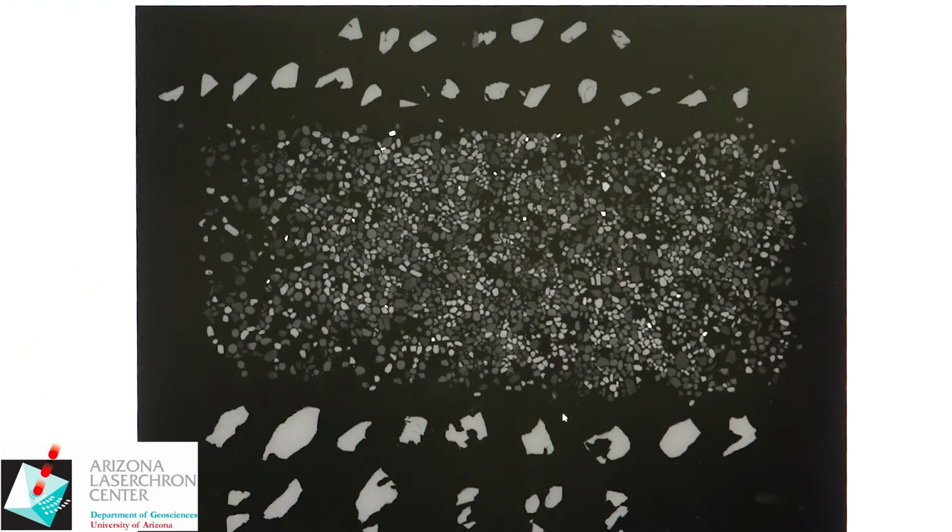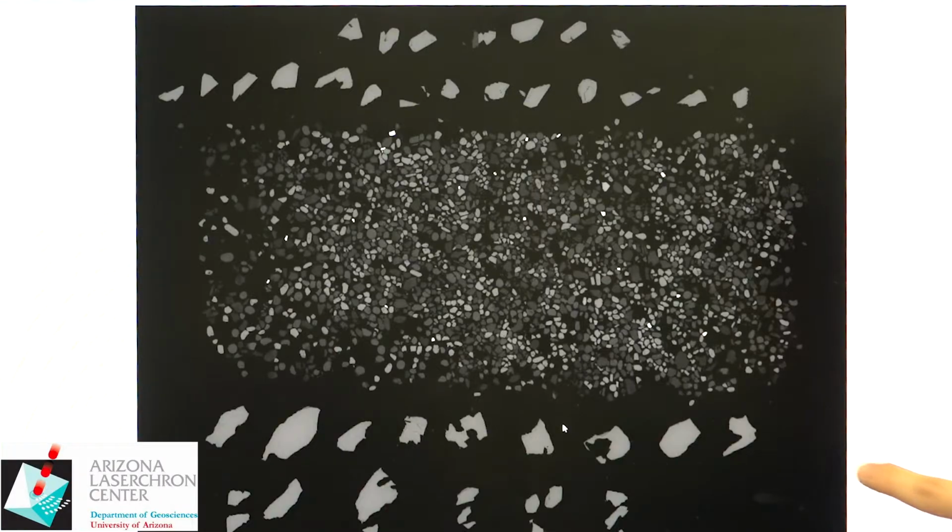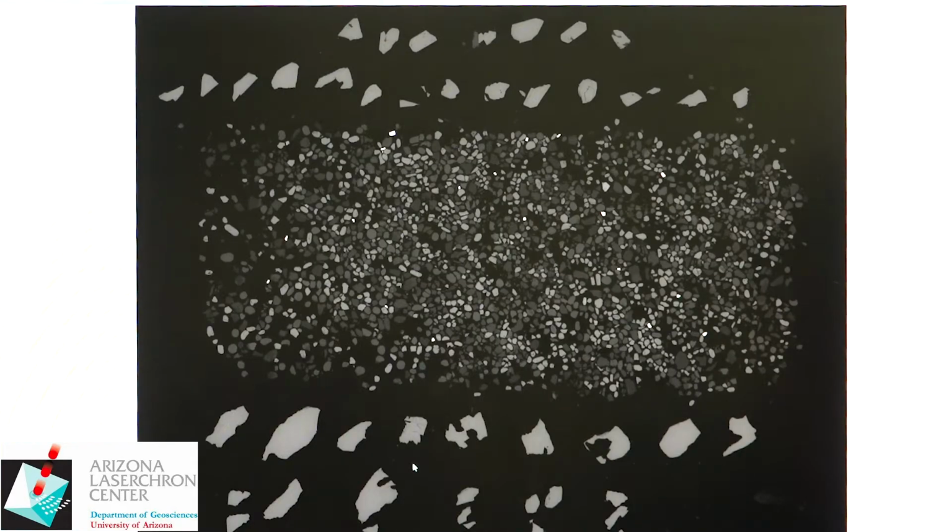Since the most abundant, heaviest element inside of zircon is zirconium, the backscatter response from it is this very light gray, flat, homogeneous, like light gray color in backscatter. And so we image all of these standards as well as the unknowns when doing a backscatter. This is because we want to reference the grayscale value from the standards itself to the unknowns. So whatever grayscale these standards come in as, that same level of grayscale should be true to the zircons within your detrital pour.